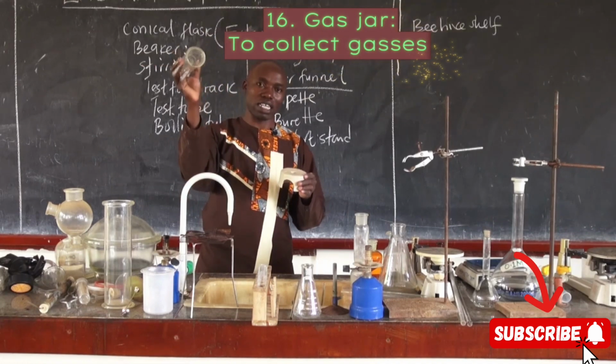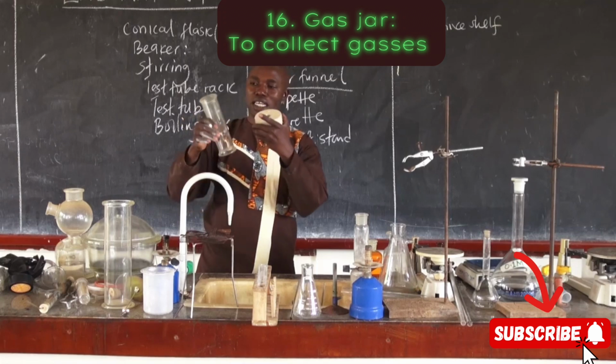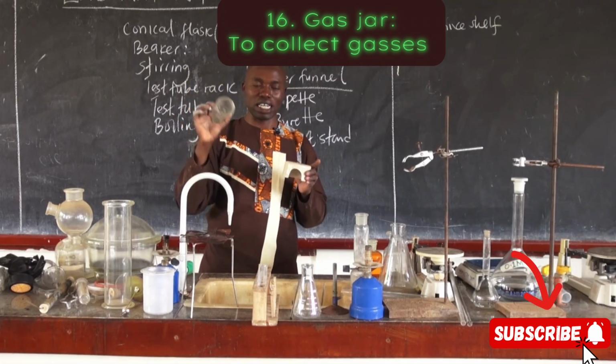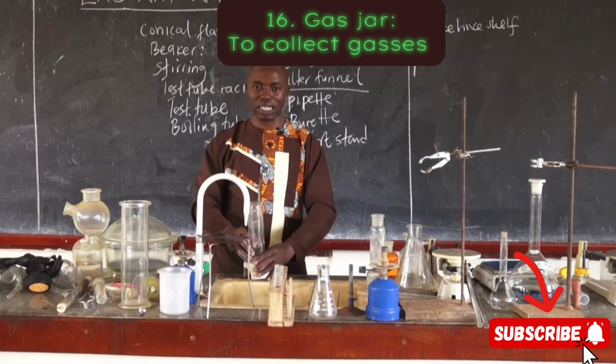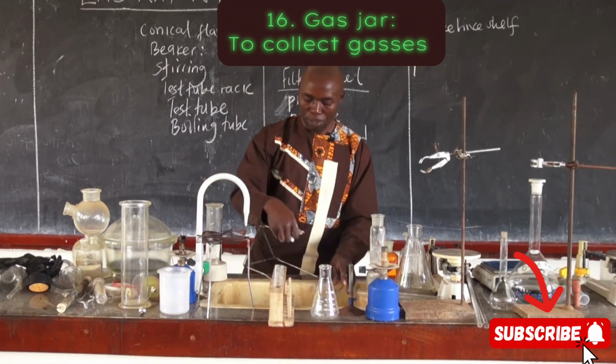So this is our gas jar for collecting gases. It has an open end and a closed end. This is the gas jar for collecting gases. This is the beehive shelf, which is normally used to support the gas jar when we are collecting the gas over water, and that one will be discussed later.